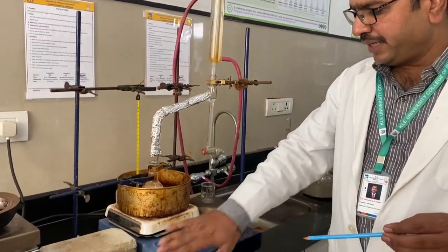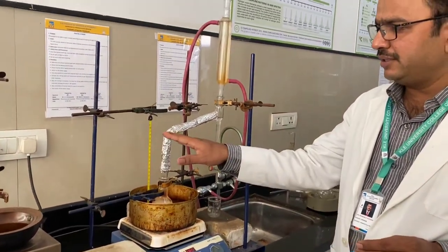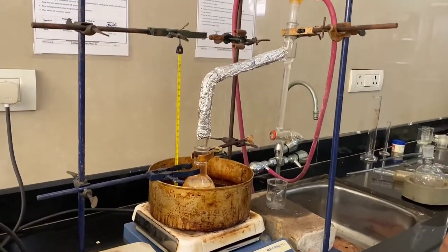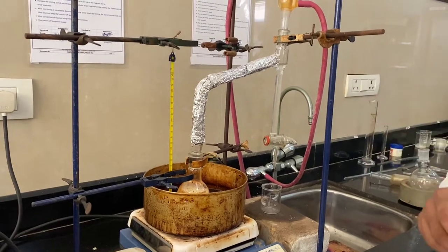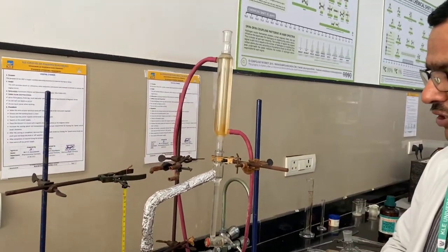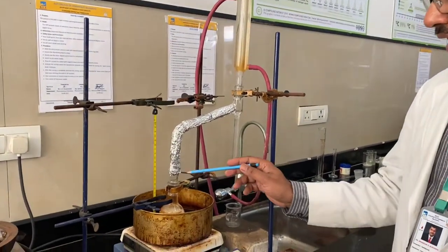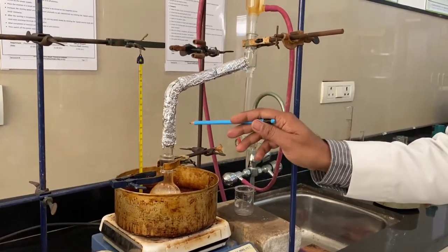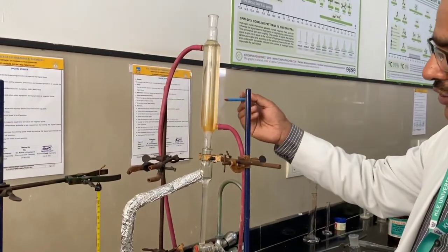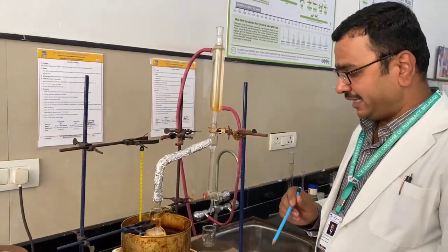Its requirements are a magnetic stirrer with a distillation setup, a thermometer to check the exact bath temperature. This is the exact setup of the Dean-Stark Apparatus. It starts with a round bottom flask, which is attached to the Dean-Stark head, and the Dean-Stark head is attached to the condenser. This is exactly the mechanism and how the reaction will take place.